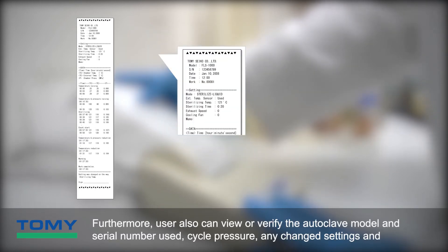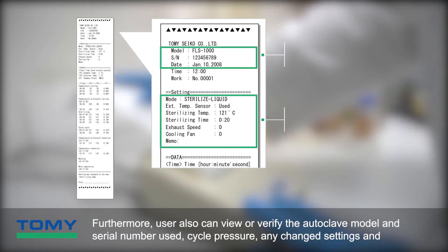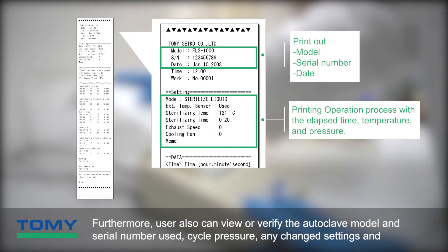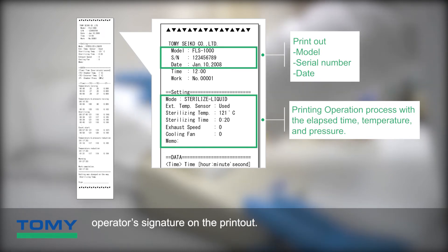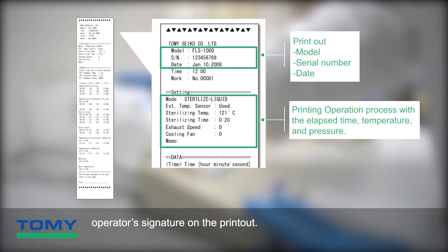Furthermore, users can also view or verify the autoclave model and serial number, used cycle, pressure, any changed settings, and the operator's signature on the printout.